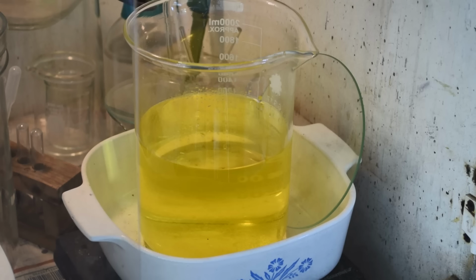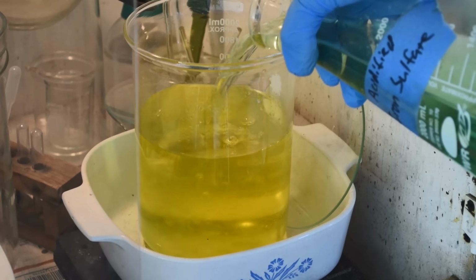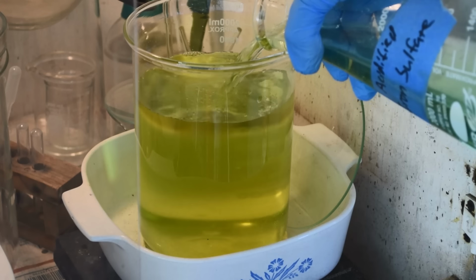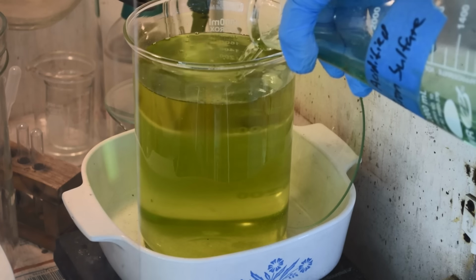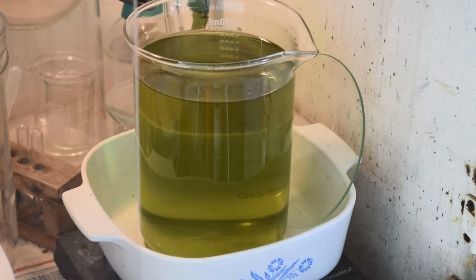I've had a little trouble using SMB with the iodine leach. I don't know why, but we get some sort of strange milky gray precipitate when I try to drop gold from the iodine leach with SMB, but everything seems to work just fine with this stuff. Well, I say that, then I put a bunch in and nothing much happens, huh? Oh, there we go. It just had to think about it for a second.